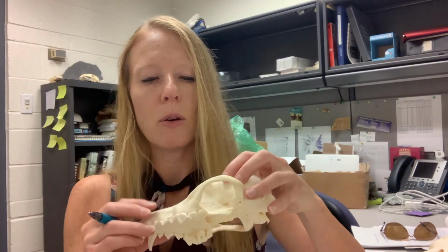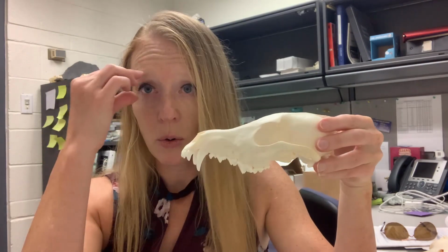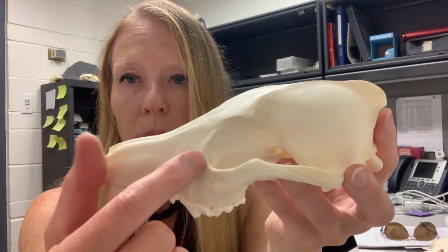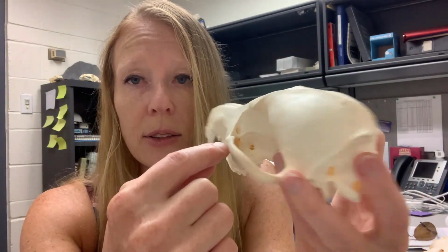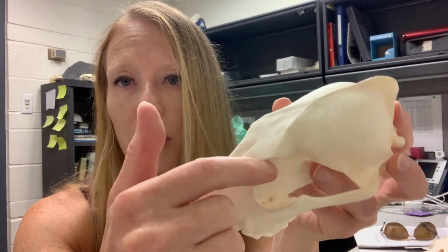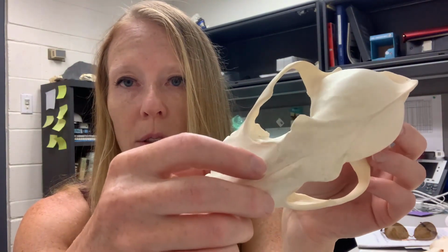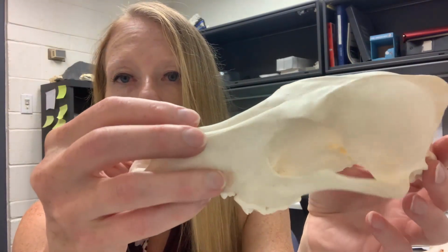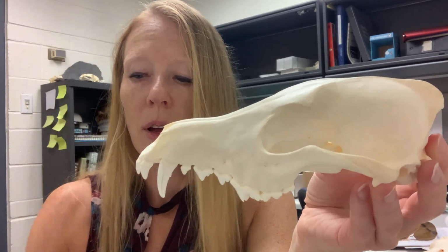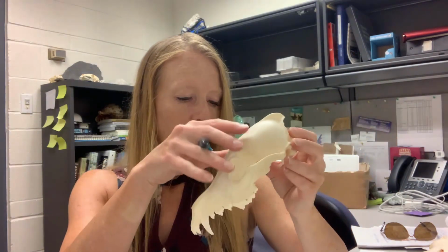And then we also are going to look at the orbit, okay? The orbit is essentially the eye socket, so where the eye is going to be placed on the skull. If we look at the coyote, the trait that we're going to assay is whether the orbit is closed or open. So this is the orbit right here, and we're going to call it open because it opens up back here to this space behind. It's not a complete circle of bone. Here's the dorsal view of the skull, here's the side view, and you can see that that orbit is not a perfect circle. So we're going to score that orbit closed, no, so we're going to give that a 0.